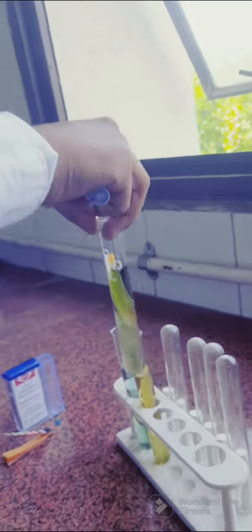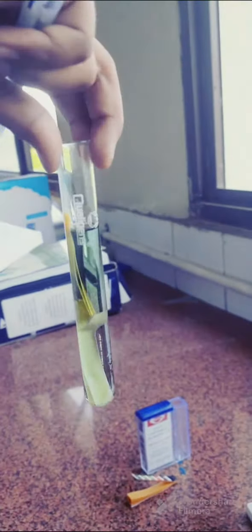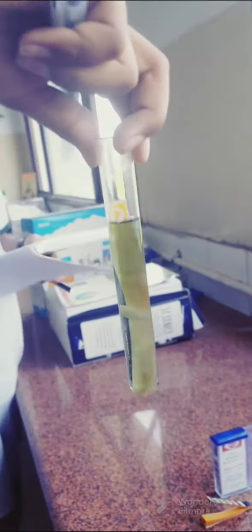This is tap water from the lab. Tap water from the lab — it is having more salt, so more alkaline. Yes.